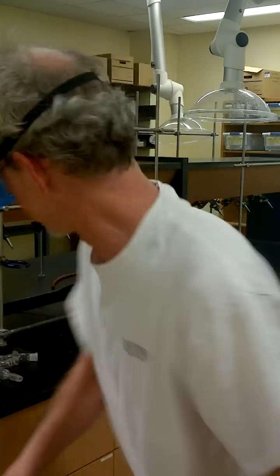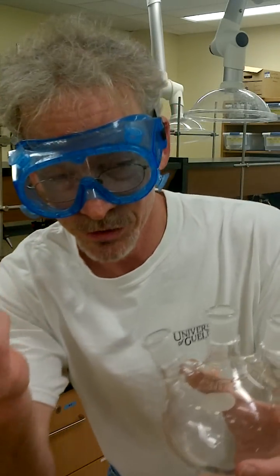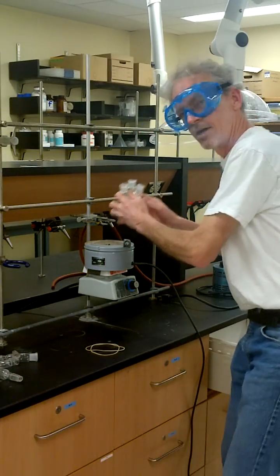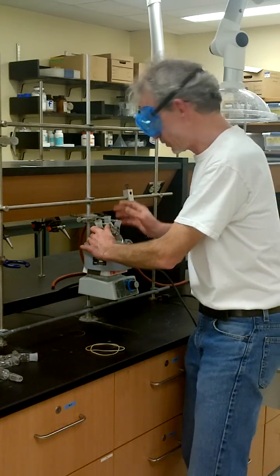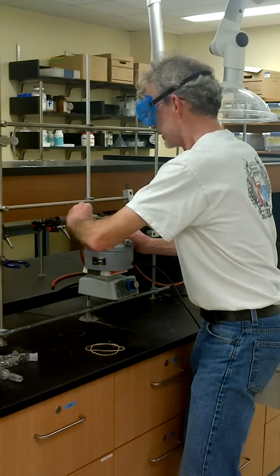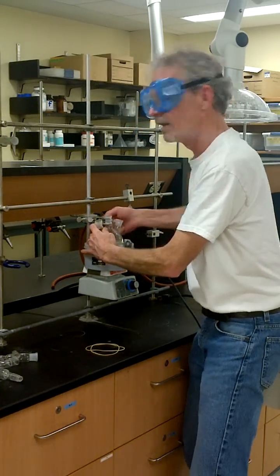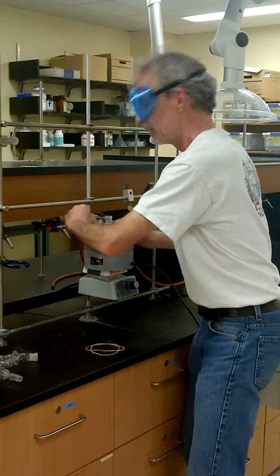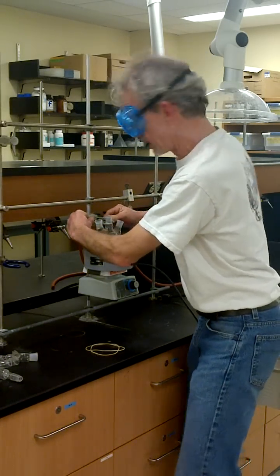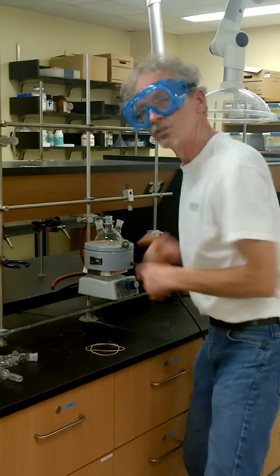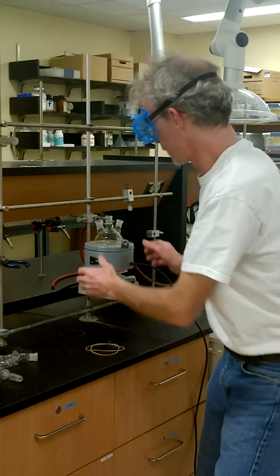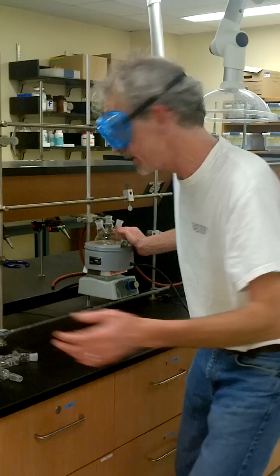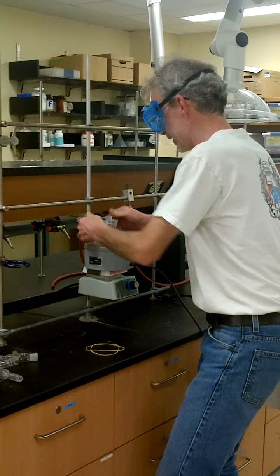Our expensive flask has to be clamped carefully. You will require a stir bar and somehow you've got to get it in here. So gently work your way in. You'll have to adjust a little bit here. Tighten both sides of the three-prong clamp. Nothing makes me crazier than a crooked clamp. There we go. There should not be a lot of pressure. It should be secure, but it should not be forced. It's glass. It'll break. What do you expect? Okay, so here we go.